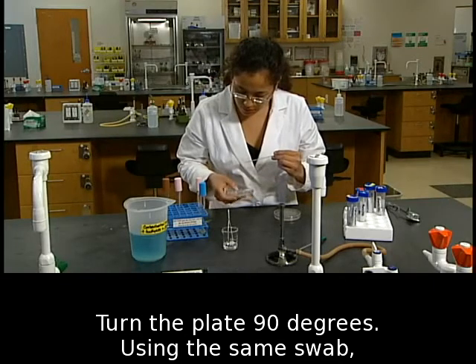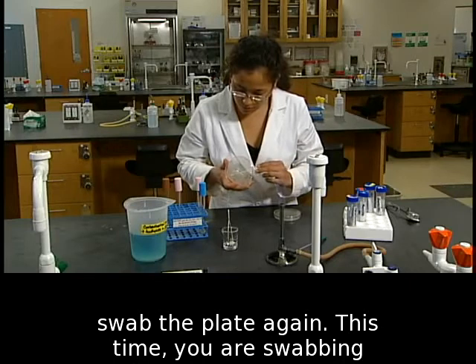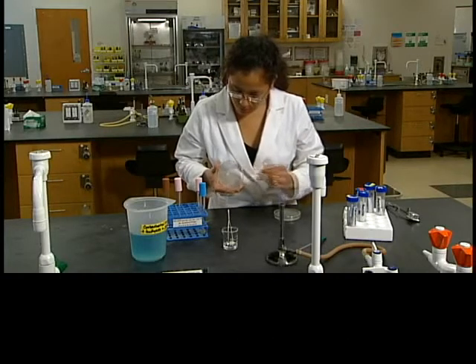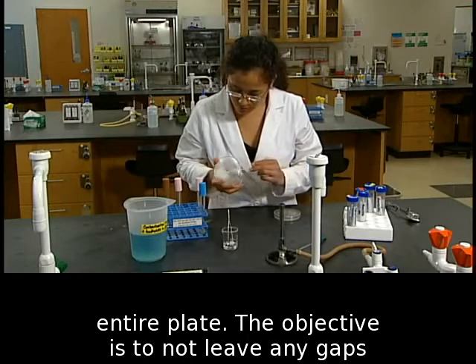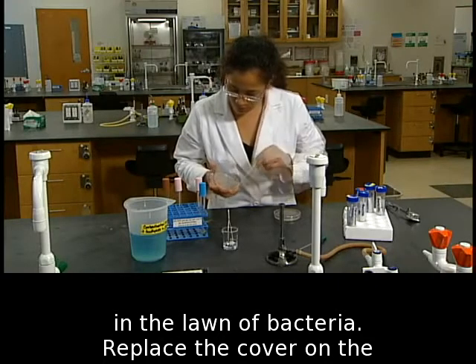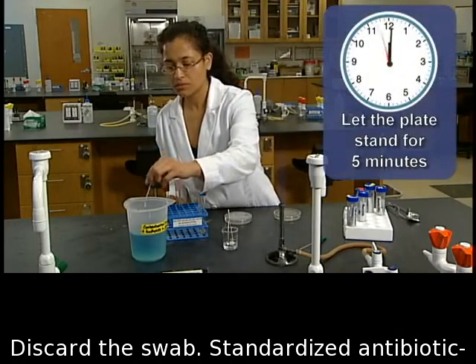Turn the plate 90 degrees. Using the same swab, swab the plate again. This time, you are swabbing perpendicular to the first inoculum. Turn the plate a quarter turn and swab over the entire plate. The objective is to not leave any gaps in the lawn of bacteria. Replace the cover on the plate and let the plate stand for 5 minutes. Discard the swab.